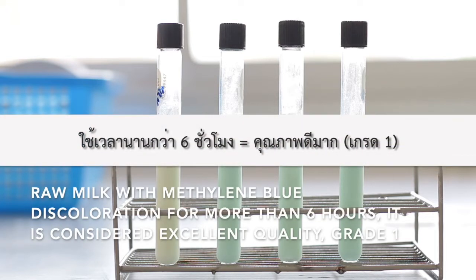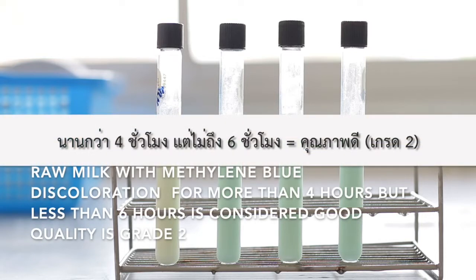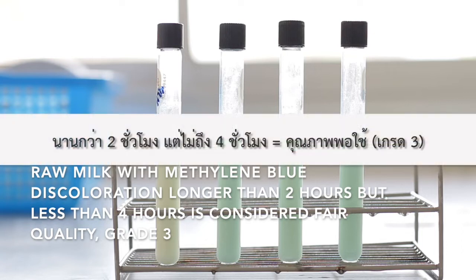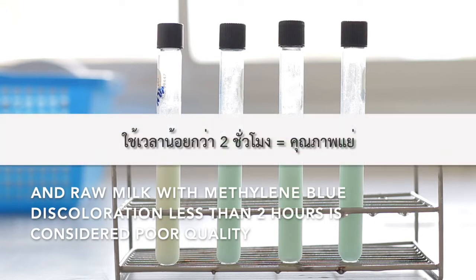Raw milk with methylene blue discoloration for more than 6 hours is considered excellent quality, grade 1. More than 4 hours but less than 6 hours is considered good quality, grade 2. Longer than 2 hours but less than 4 hours is considered fair quality, grade 3. And discoloration in less than 2 hours is considered poor quality.